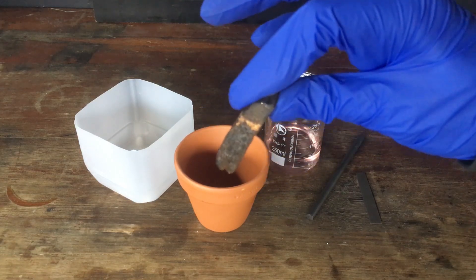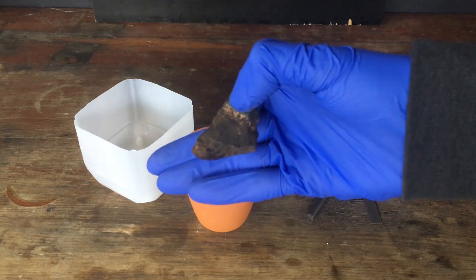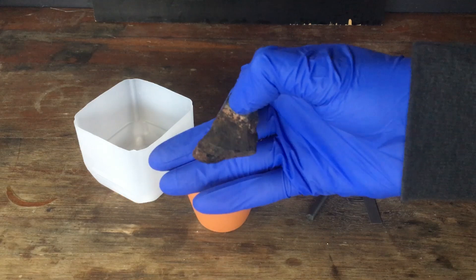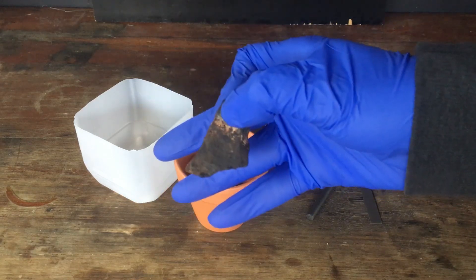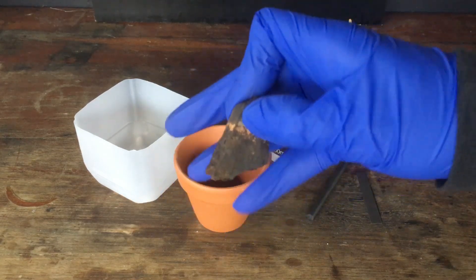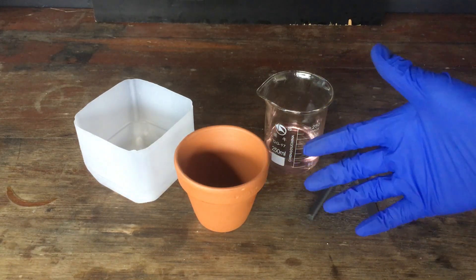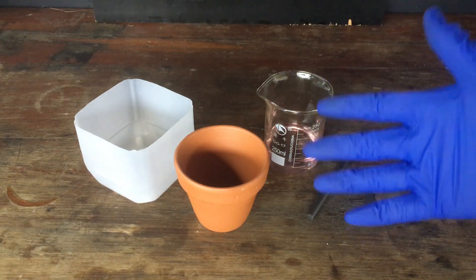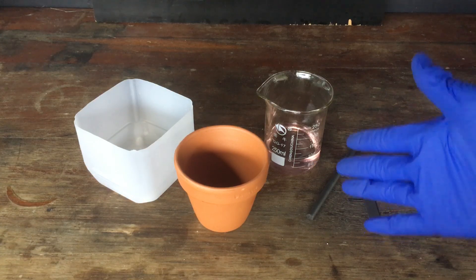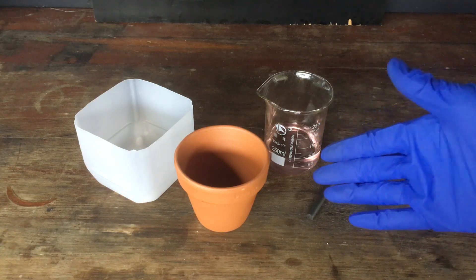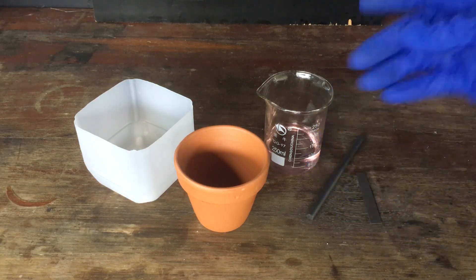You can see here this is a chunk of manganese that I used for the process. I had to buy this off eBay, and it wasn't particularly expensive, but it was a little bit hard to find. So basically, trying the reaction again, we don't want to use the less available manganese metal, and we want our starting material to be the much more available manganese sulfate.